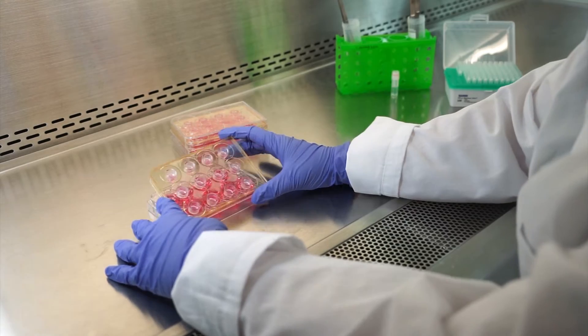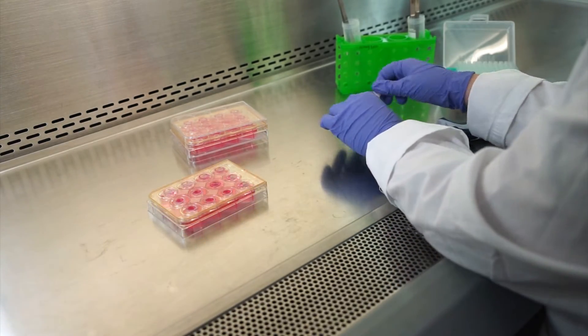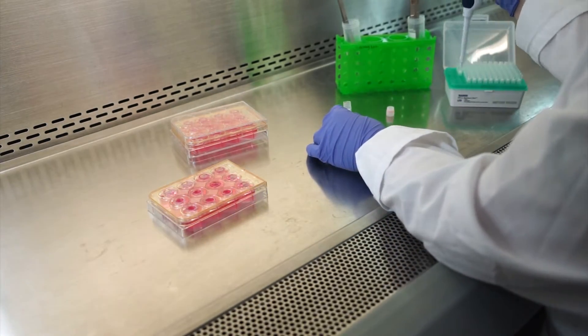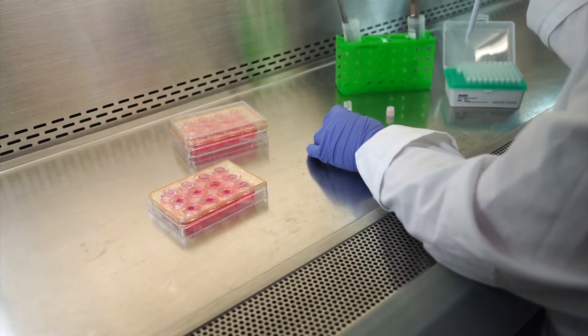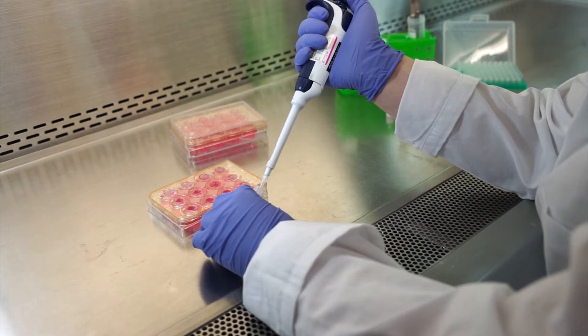The test article of choice is then added to the apical surface of the tissue at the desired volume and concentration or range of concentrations.